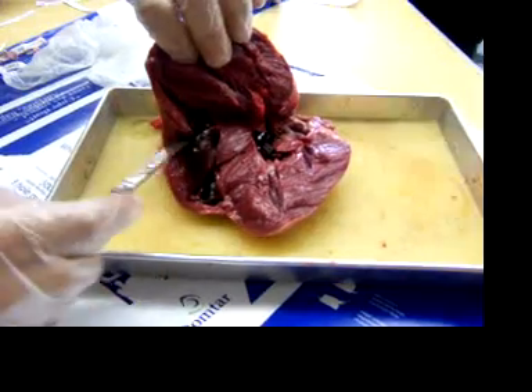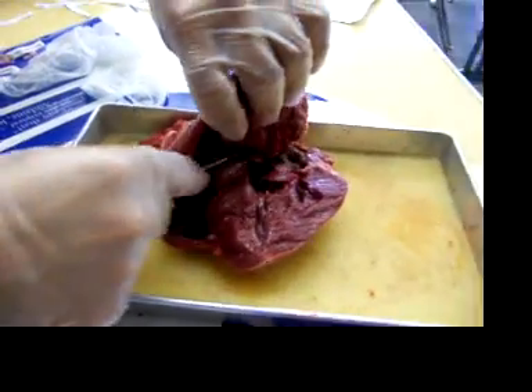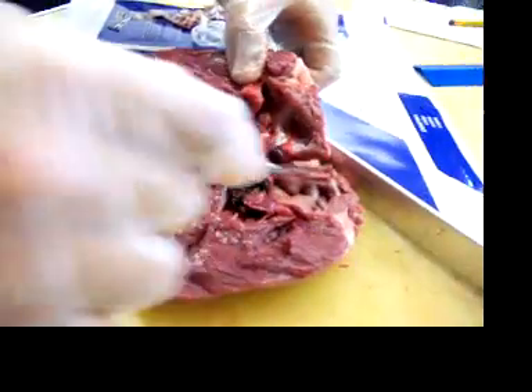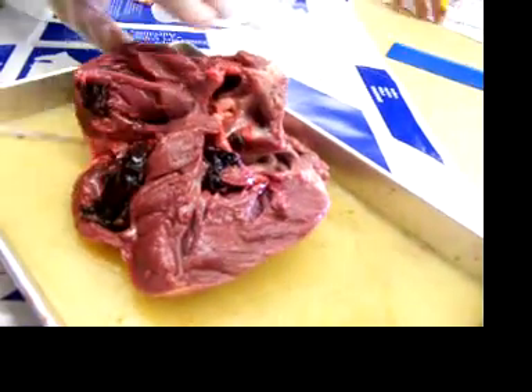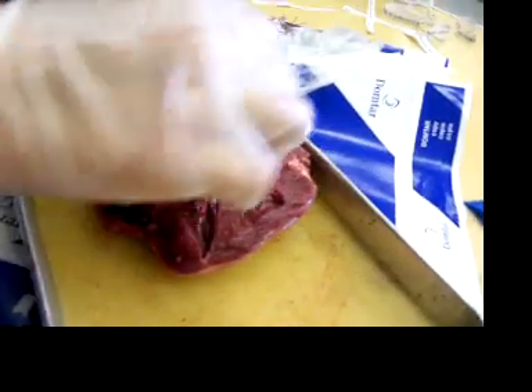Just cut it right in half. I can't — it's like filleting a fish. Did you record this? Yeah, it is like filleting a fish. We don't print it, yeah we did. Is that good enough? You start labeling it. Okay, here's our heart, time to cut it. Stop video now. Stop video. How do you stop it? Just press stop, press the off button. I have bloody hands. How do you stop it? The pig guts — just go over there.